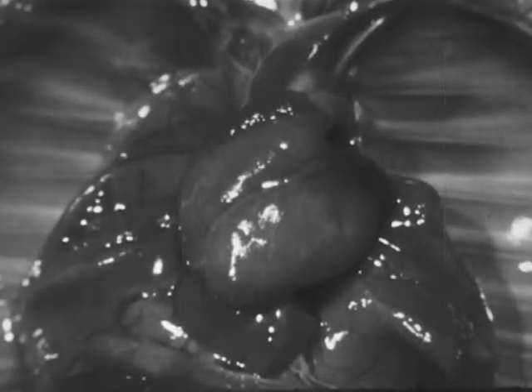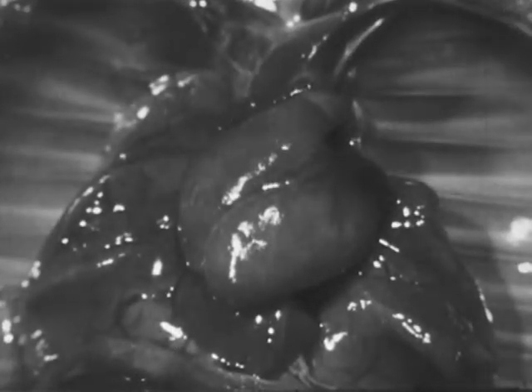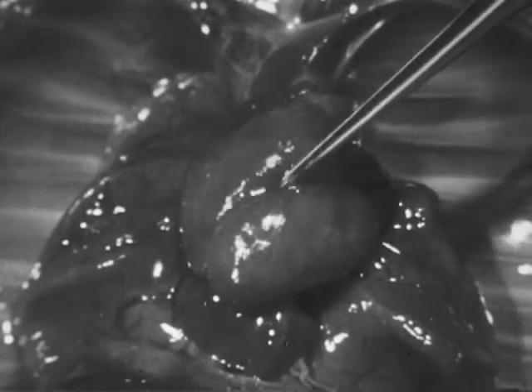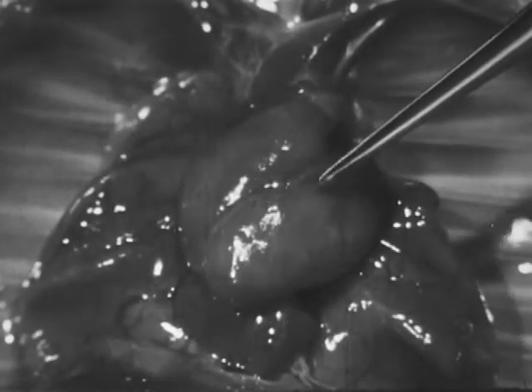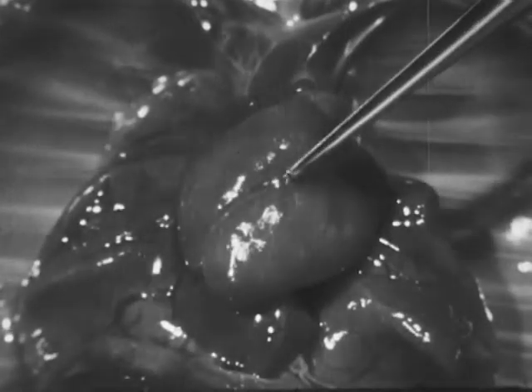Removing the pericardium permits a better view of the heart. The heart has four chambers, which is characteristic of all mammals. The two upper chambers are the thin-walled auricles, which receive blood from all parts of the body. The two lower chambers are the thick muscular ventricles, which pump the blood to all parts of the body. This is one of the coronary arteries, which supply blood to the tissues of the heart.